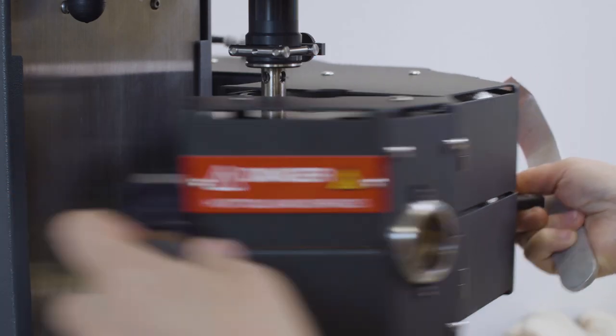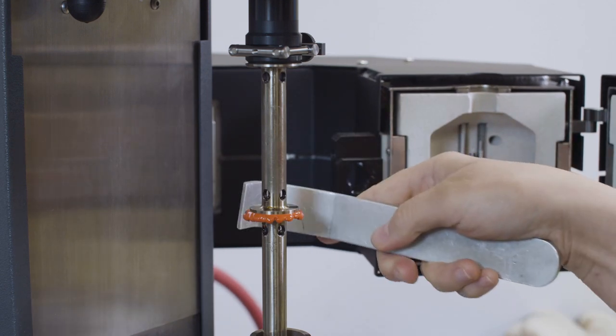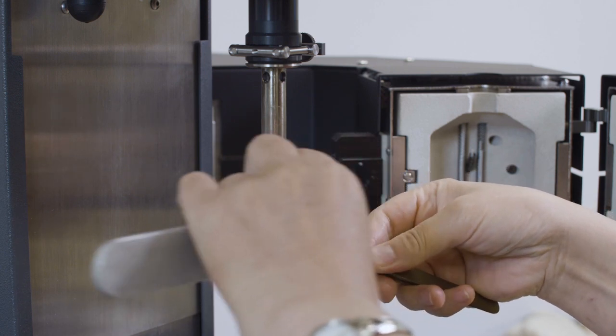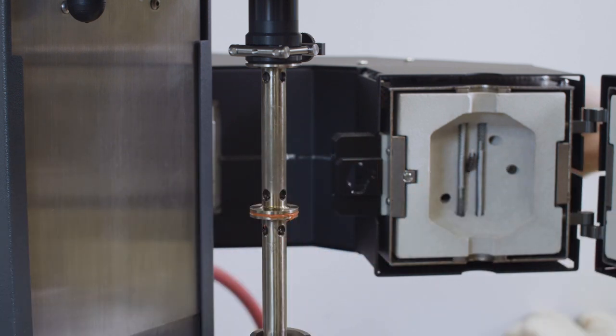Open the FCO. Use the trimming tool to trim the excess amount of sample from the edge of the 25 mm plate. Close the oven immediately.